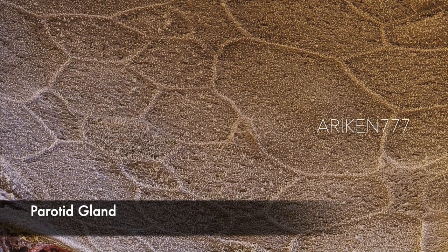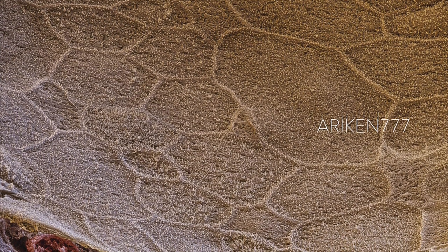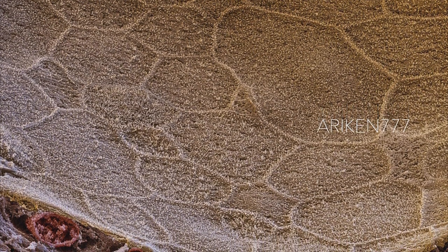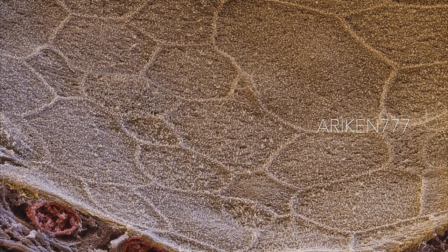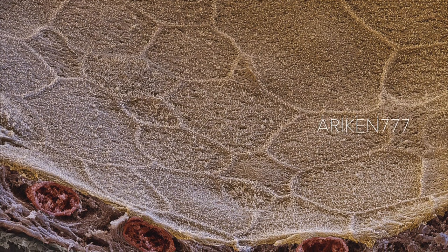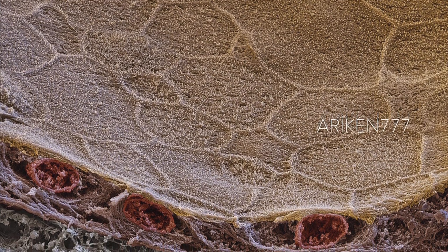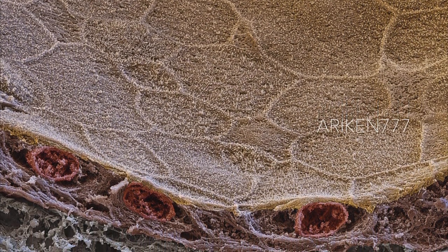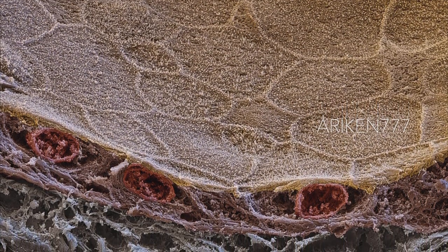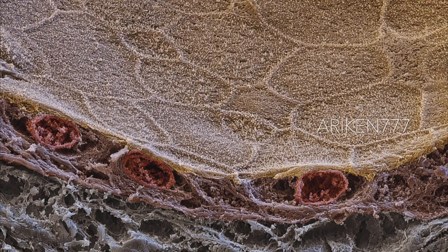This is a section through the parotid duct, a long excretory duct where saliva is drained out from the parotid gland into the mouth. Clearly visible are the honeycomb-like cells of the epithelium and three nuclei on the edge. The duct pierces the buccinator muscle then opens into the mouth on the inner surface of the cheek, usually opposite the maxillary second molar. The parotid gland is a major salivary gland in many animals. In humans, the two parotid glands are present on either side of the mouth and in front of both ears. They are the largest of the salivary glands, contain enzymes and proteins, and facilitate mastication to begin the digestion of starches.